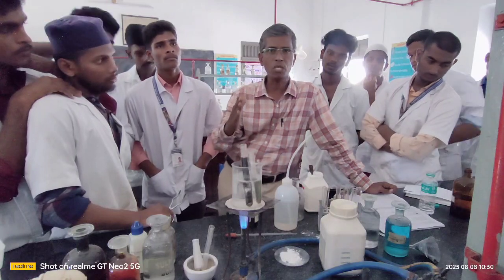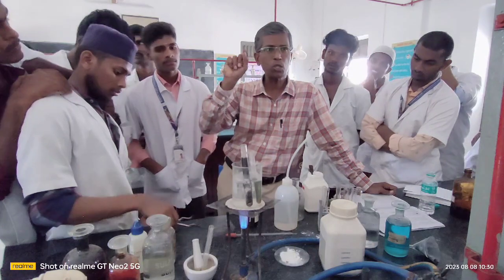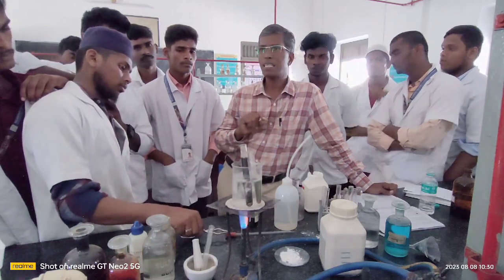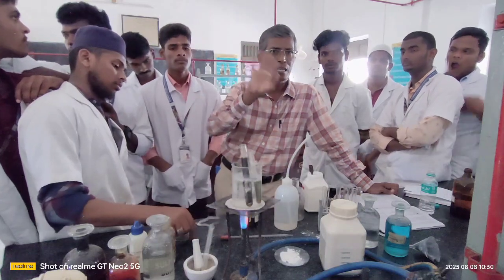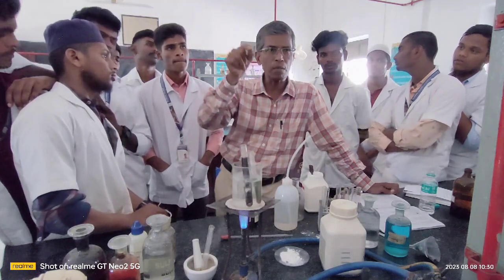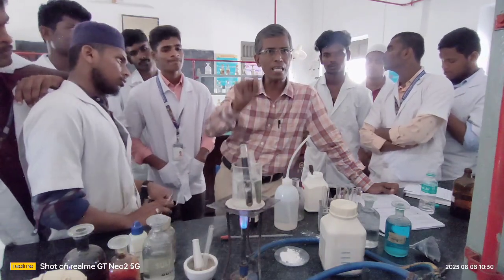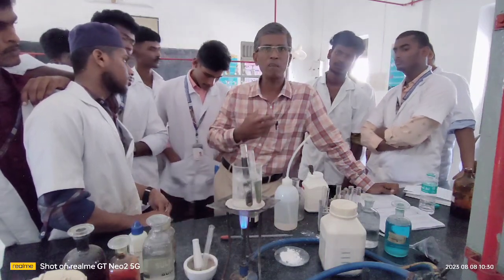Remember, while writing the answer, the positive report should alone be written, not the negative report. For example, when you do the sodium fusion extract test strictly, you will get either blue or green, never both. Therefore, you write according to whether you get blue or green. Some may get blue and some others may get green. You write down whatever color you get while performing the test.